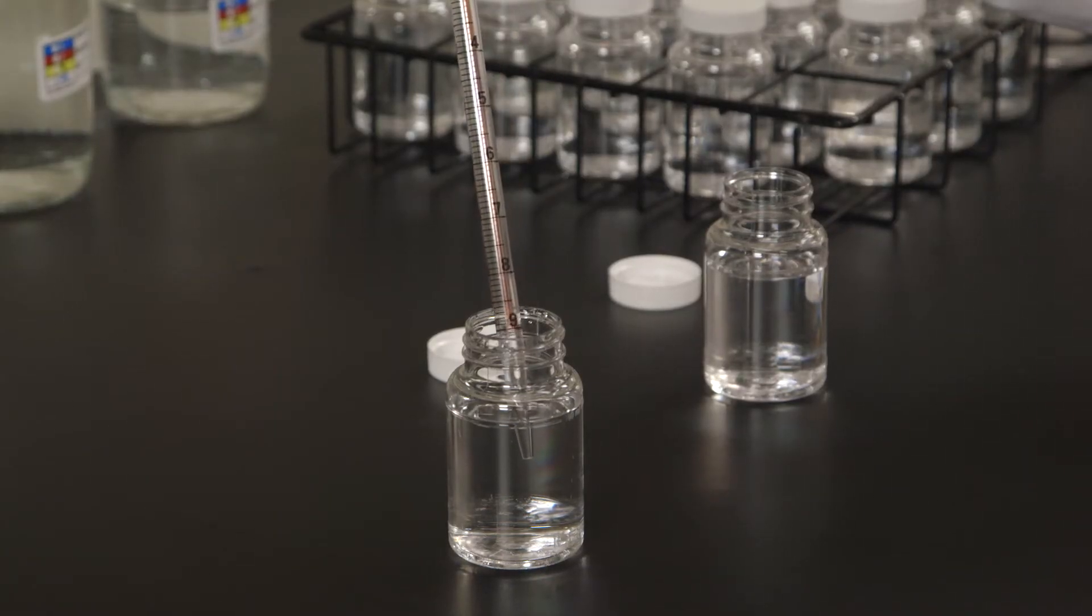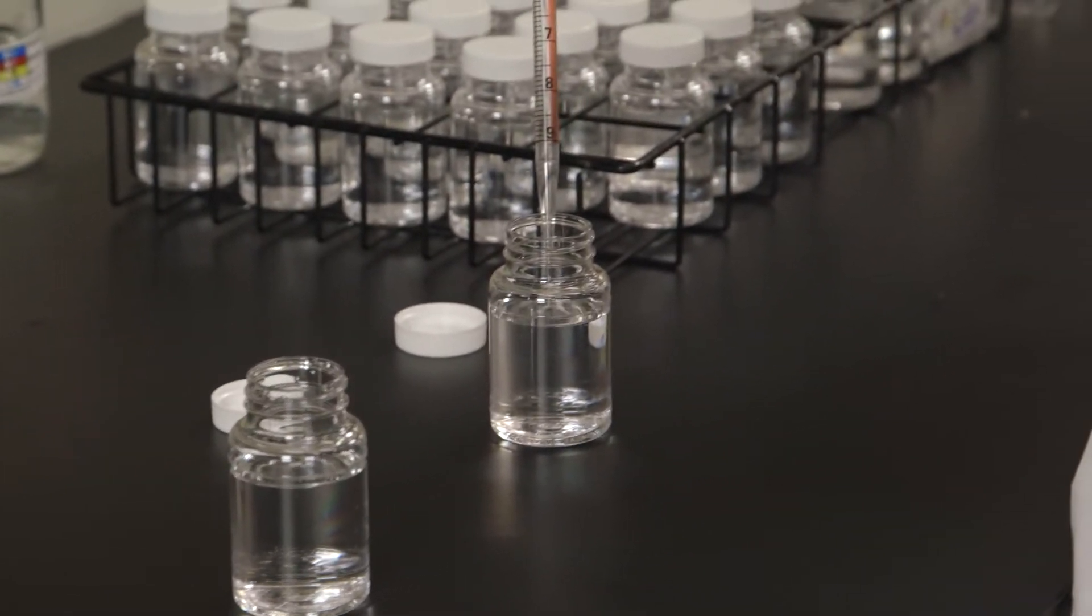Add 10 mL of sample to 90 mL of sterile water and bring the sample to room temperature.